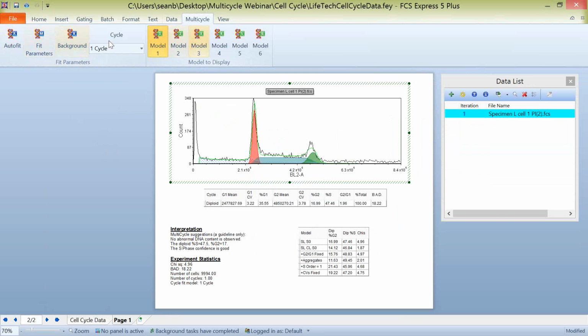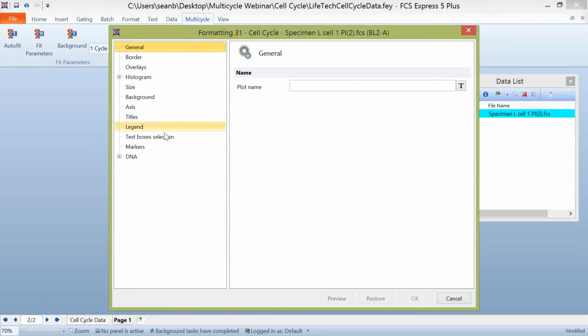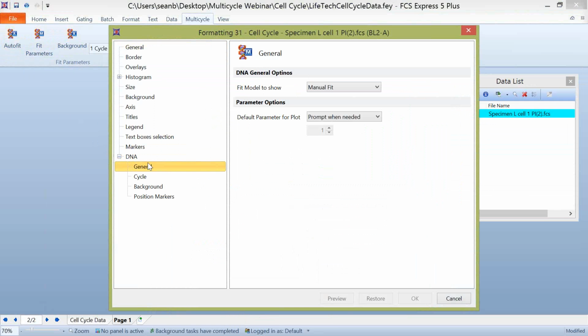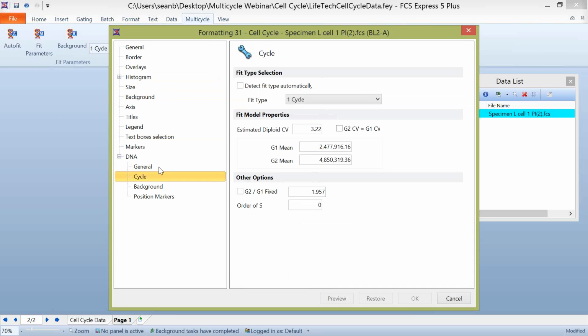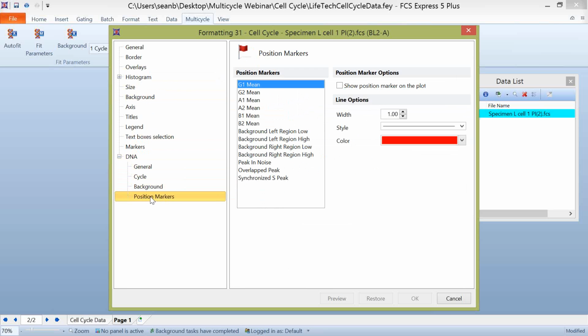And instead of using our Multicycle tab here, I generally like to show or also use, when we right-click on a plot, we can choose Format. And in this formatting tab, you notice that there's actually a few more things that you can choose within the DNA section. This is a special section that's going to appear with your cell cycle data only. This is going to allow you to have all of the general options that we have up here, access to the fit cycle parameters, our background parameters, as well as showing different position markers on the data.